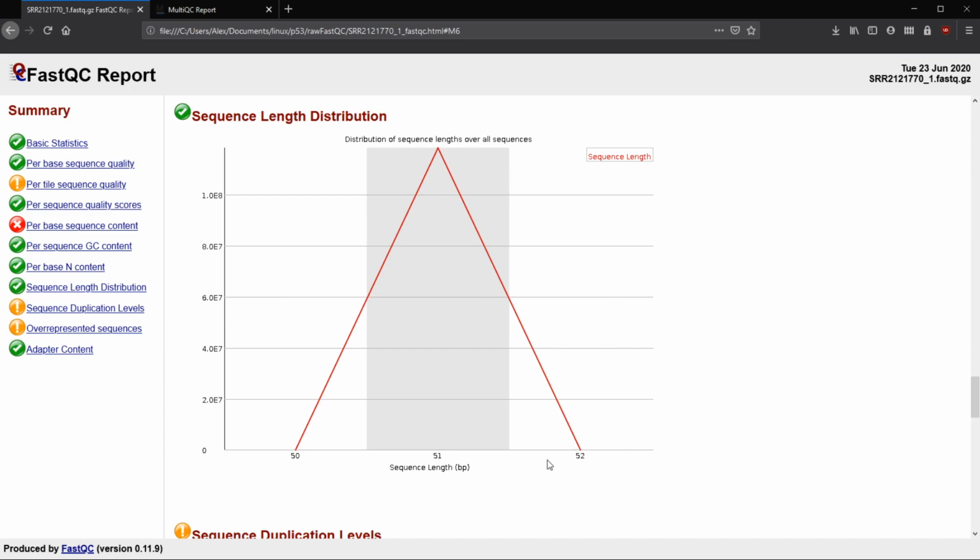And a warning here is going to happen if not all the reads are the same length. So if we had some here, we would just get a warning. And then we're going to get a failure for sequence length distribution if one or more reads have a 0 length. So if we have a 0 length read, it's obviously not a good thing. So that's going to be the sequence length distribution.